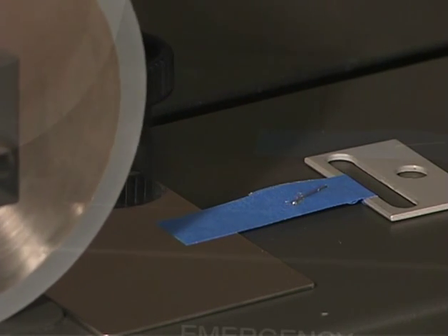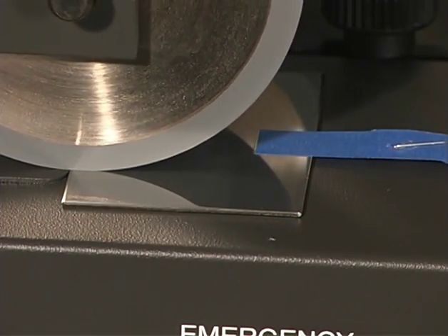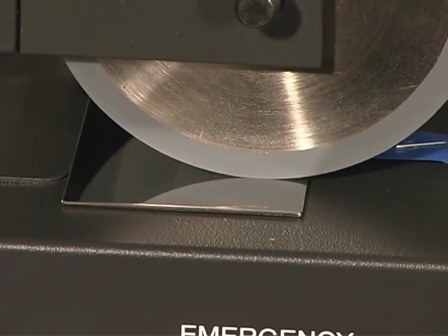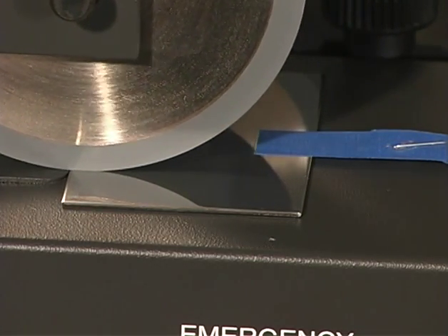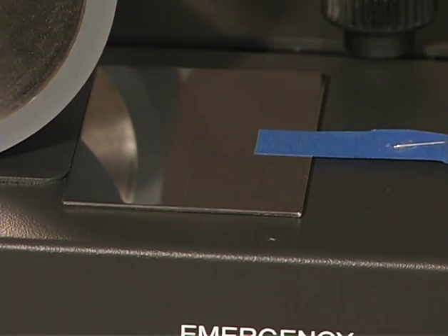Because a longer dwell time can increase adhesion, individually prepare each specimen and test within one minute. However, if you are testing for increased adhesion at longer dwell times, prepare your samples consecutively and allow them to remain untested for the prescribed period of time, then test them in the same order in which they were prepared.